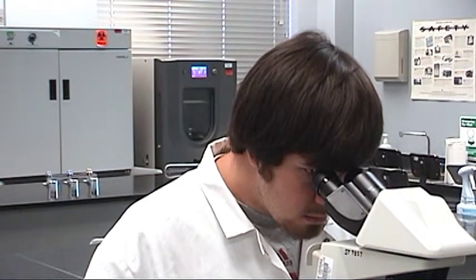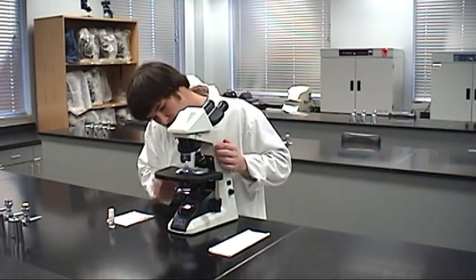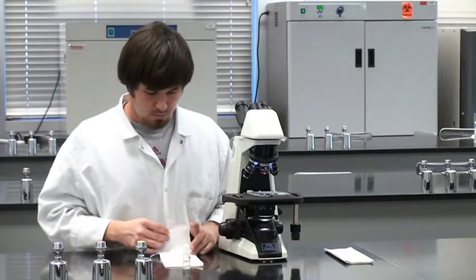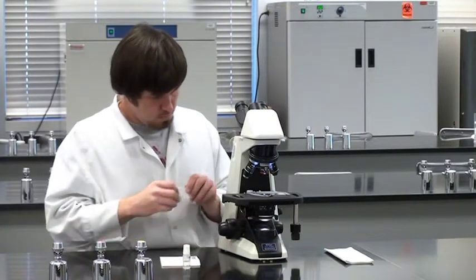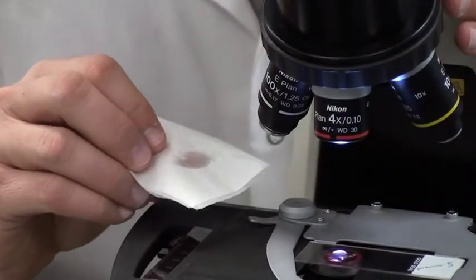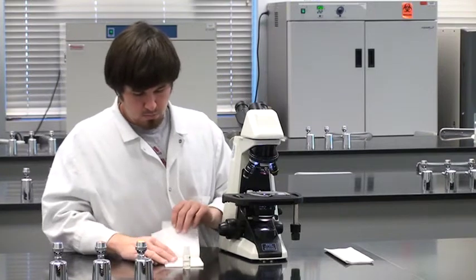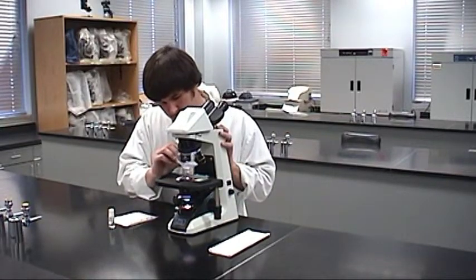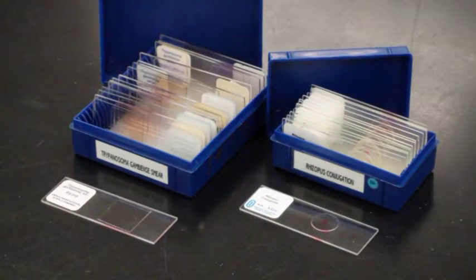When you finish viewing the slide, clean the oil off the lens. First, rotate the scanning objective into place, then drop the stage to its lowest position. Tear off a few sheets of lens tissue to clean the objective lens. Make an absorbent cushion by folding the pieces together into quarters. Gently but firmly, wipe the objective lens, then inspect the tissue for oil residue. If you see any residue, refold the tissue or reposition it to expose a clean area, then wipe the lens again. Repeat until no oily residue is visible, using new lens tissue as needed. When you are done viewing a prepared slide, clean the oil off of it with paper towels and water, then return it to its storage case.